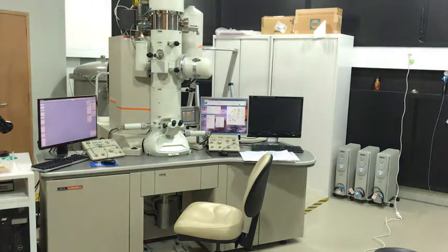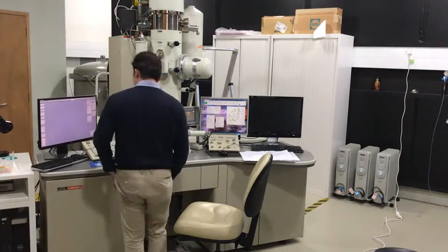So what I need to do next is remove, spread the beam to the whole screen, which I've done. Switch the beam valve off, much easier to shut down. Cover the viewing screen. And now, turn the lights on, turn off all the alignment buttons. I can turn the lights back on again. Okay, now you should get a better view of everything.